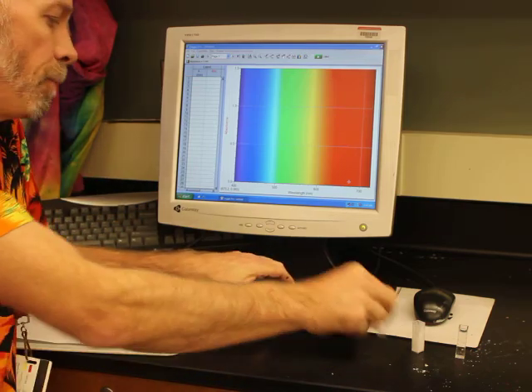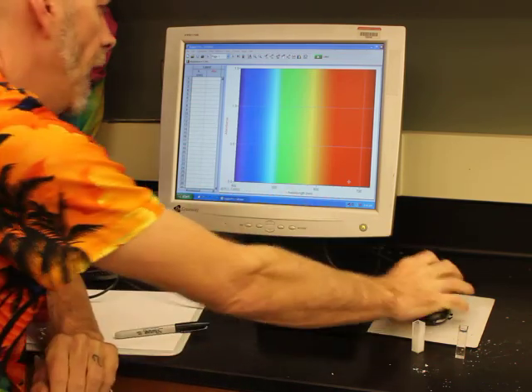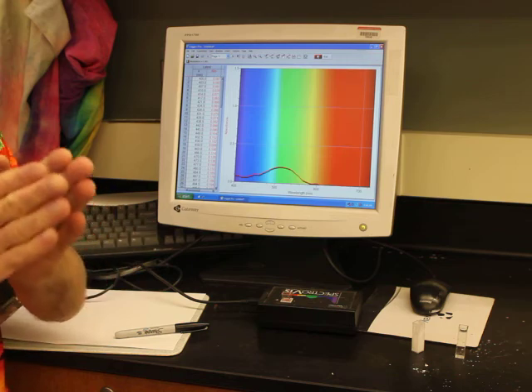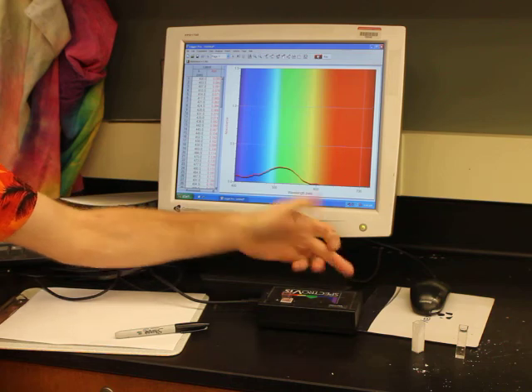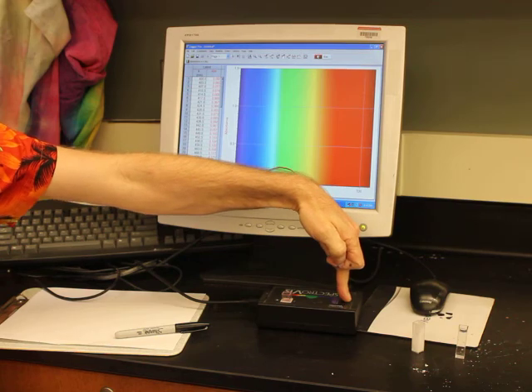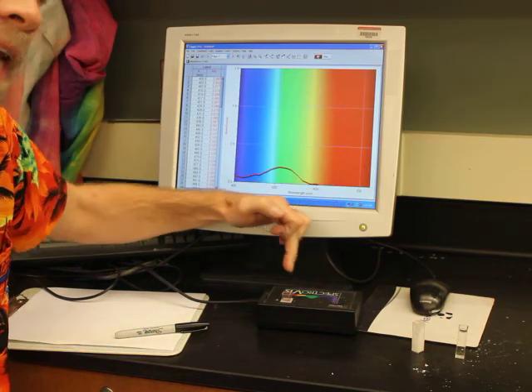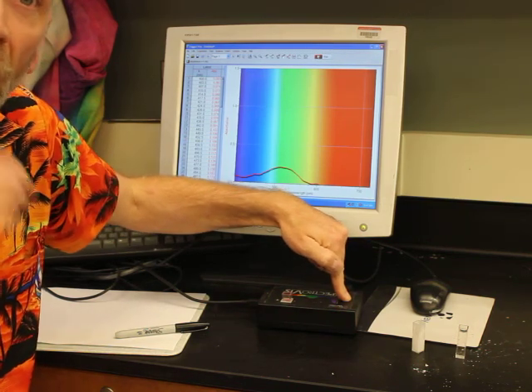So what happens is I put in my sample, and the light is going through, and the prism is adjusted at such a point that for a brief moment in time, the light that is 400 nanometers is hitting my detector, right? And it sits there and it counts it for a few milliseconds. And then the prism turns just a little bit, such that now the color photon that's hitting the detector is 405 nanometers. It waits there for a couple of milliseconds, counts that.